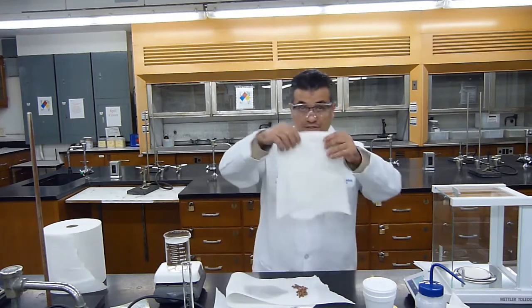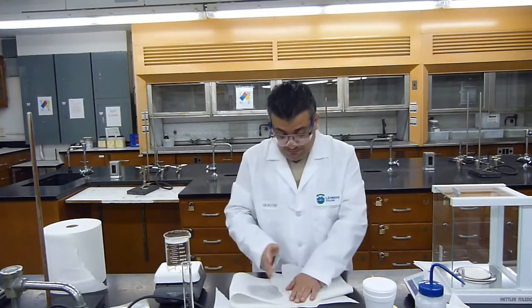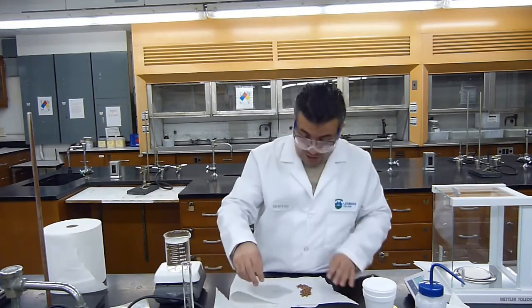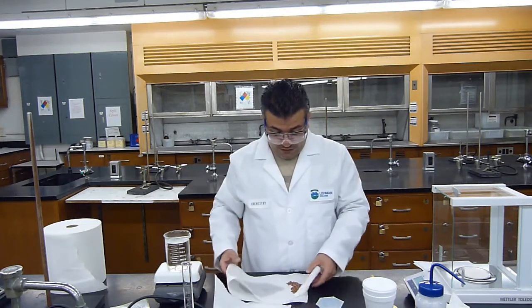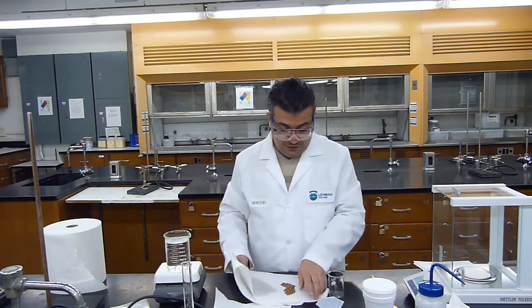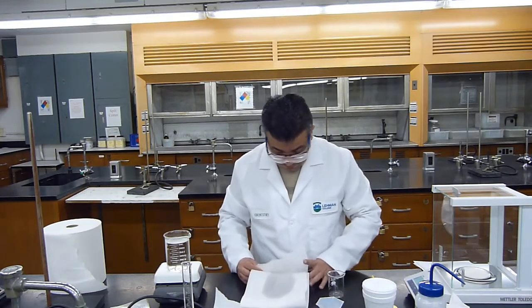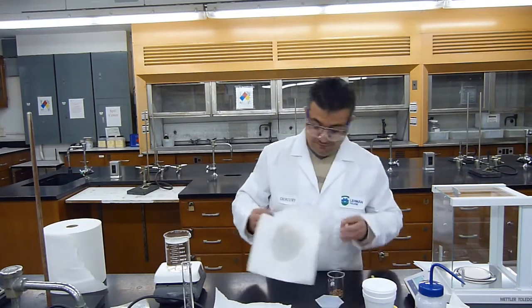Okay. I will put the other piece of paper towel on it. Press to absorb any liquid that's on here. If we do a good job, okay, the metal will be nice and dry. Okay, I will put back all of the metal. You could use a beaker, or actually we could just bring this beaker here. I'll use a beaker instead of a weighing boat. Okay, I will put all of the metal into the beaker.